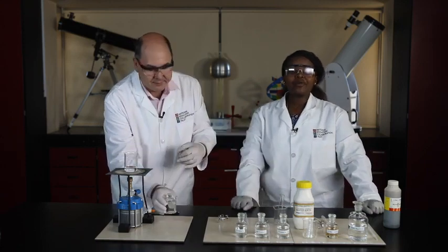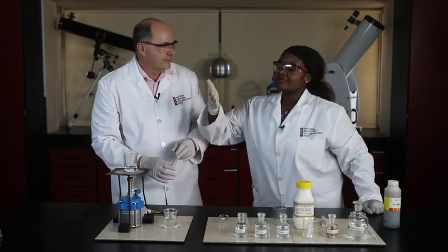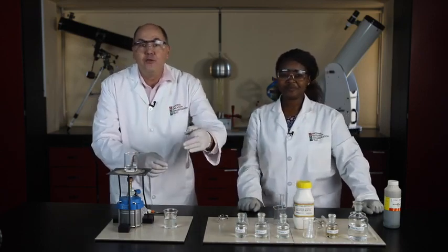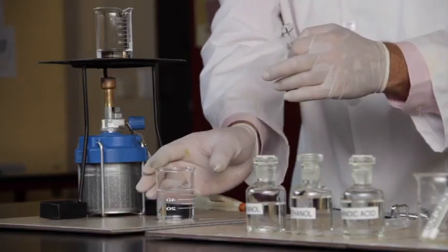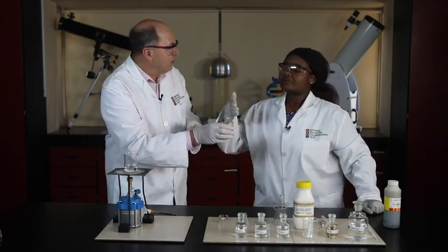Remember that in any laboratory, chemicals are smelled by wafting the odor towards the nose with a hand like this. Beautiful. Now, you never put your nose over the reaction mixture when you smell anything. This particular mixture, I can't quite place it, but it certainly doesn't smell of vinegar. What do you think it smells like?